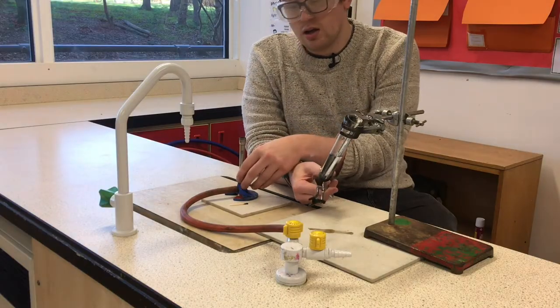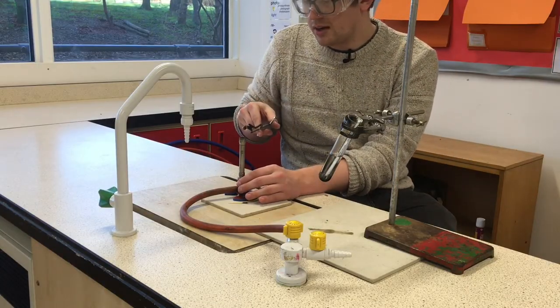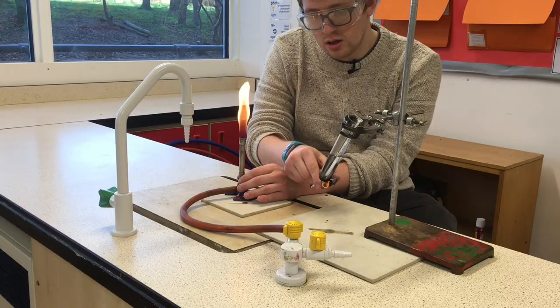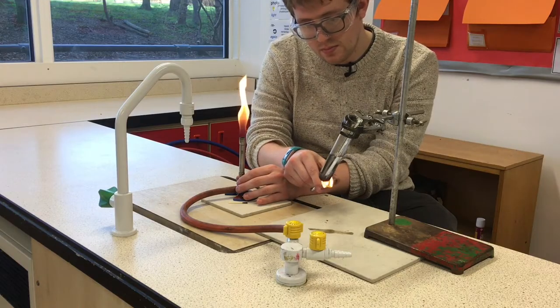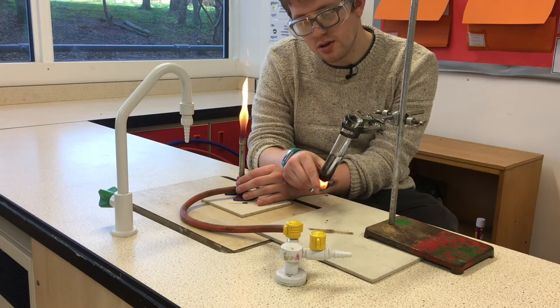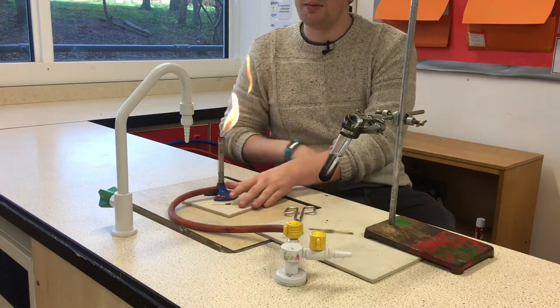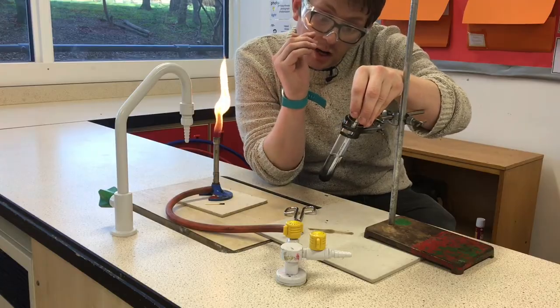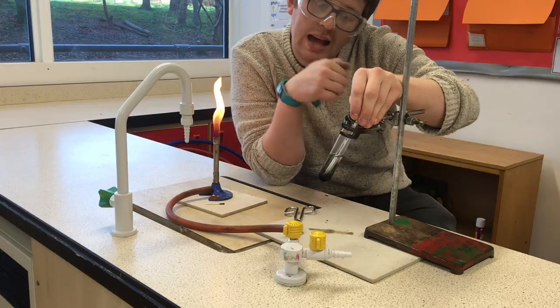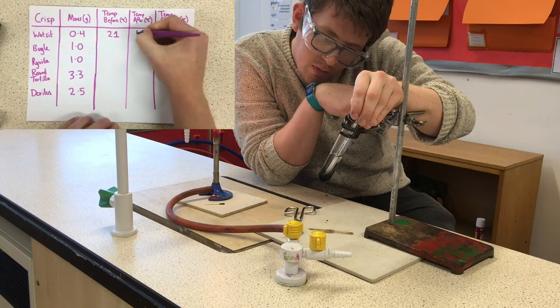I've got a little bit more crisp on there, just trying to light that last bit and maximize every last drop of energy from that crisp. This is all flame from the crisp I wouldn't have got otherwise — you can see it's actually quite black. When this goes out I'm going to look at the thermometer. The temperature might still be going up, so I want to watch and see how high it goes, and as soon as it peaks and starts to come down I'll write down that temperature. I can see it's just crept up a little bit more — about 42 degrees.